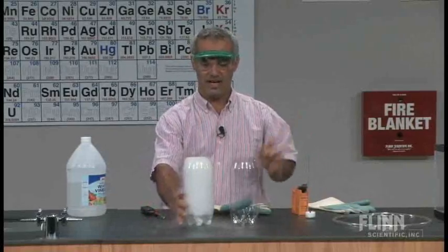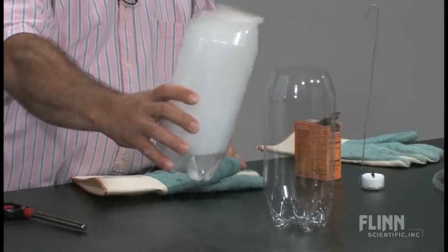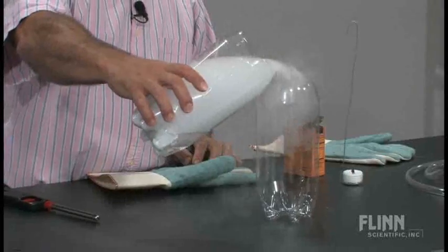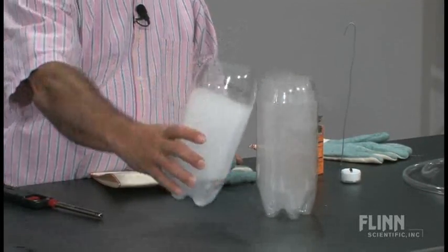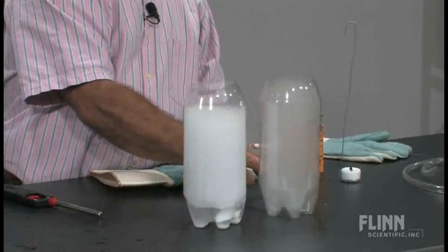Then what do I do? I poured it. And watch what happens as I pour it. It definitely ends up in there. But notice how it's not nearly as concentrated. That's not pure CO2.